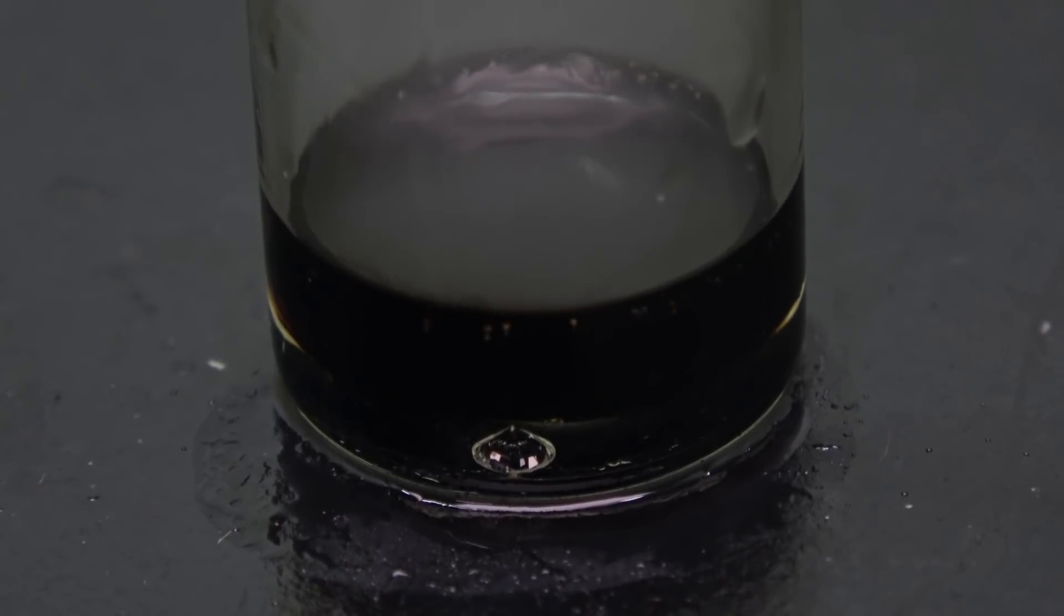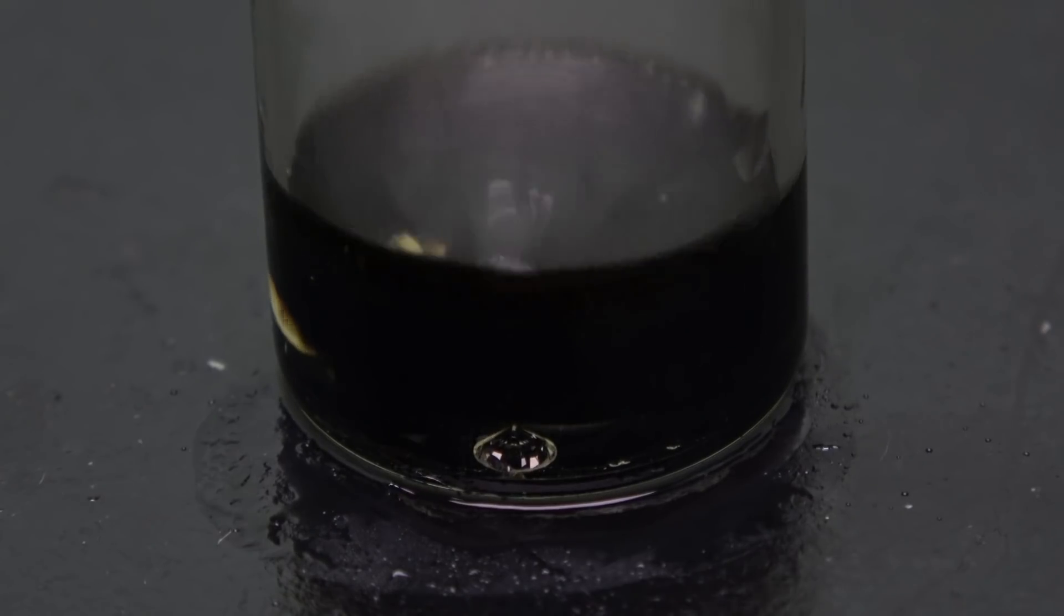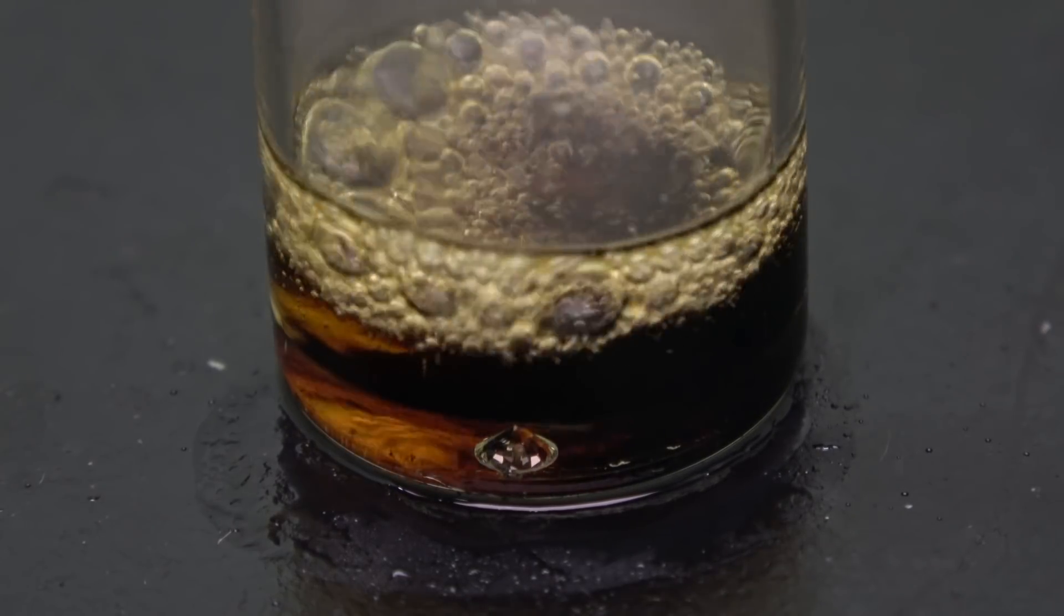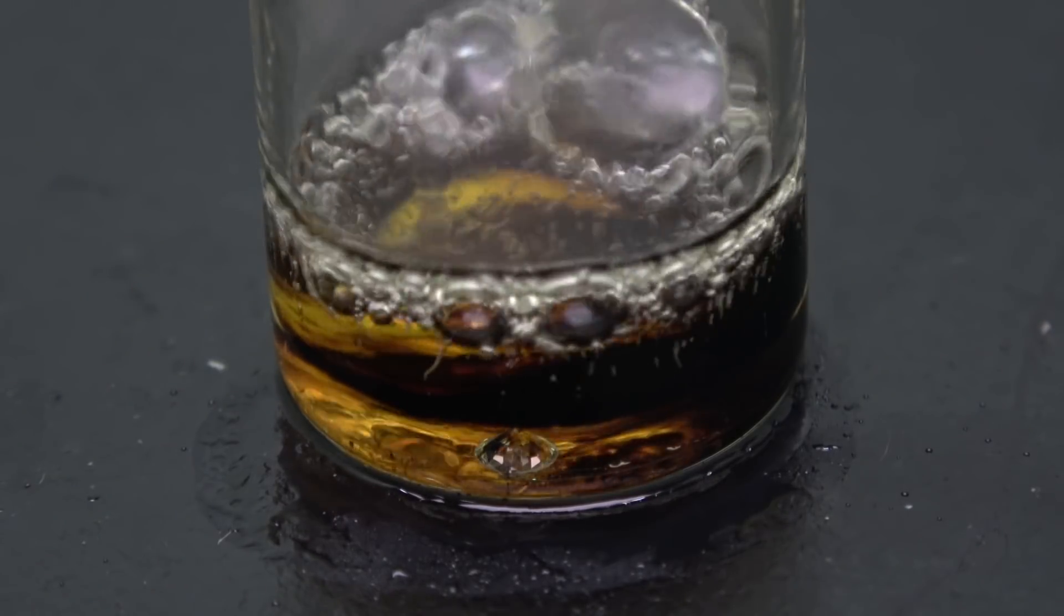At this stage, all of the glucose molecules have been carbonized. As I gradually add in the hydrogen peroxide, the solution started to clear up.